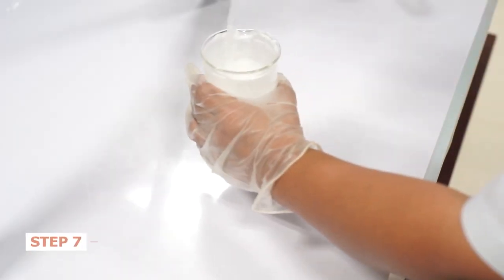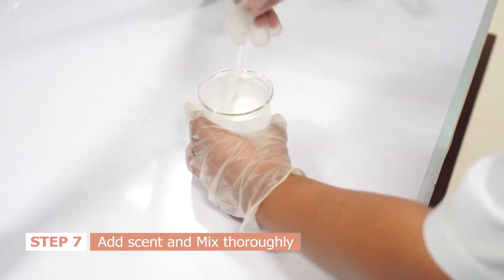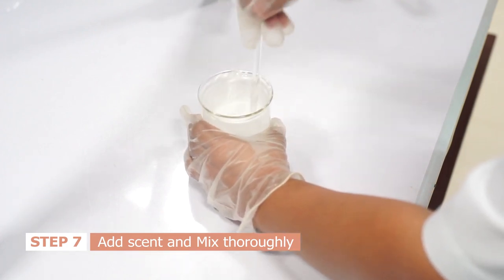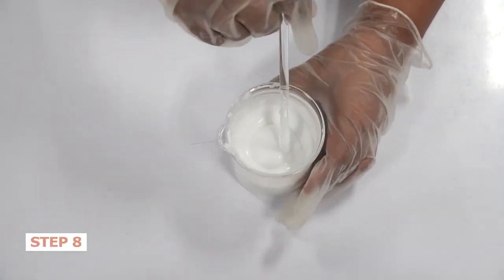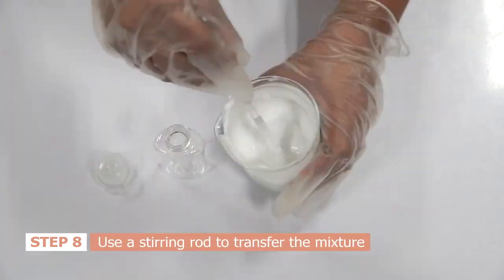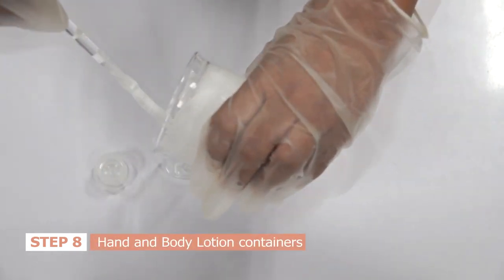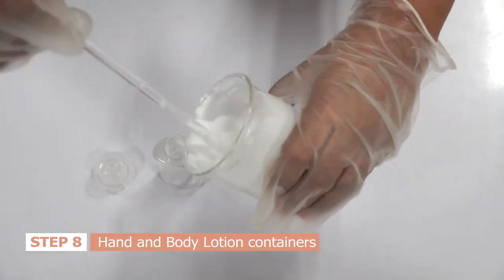Add scent and mix thoroughly. Use a stirring rod to transfer the mixture to your hand and body lotion containers.